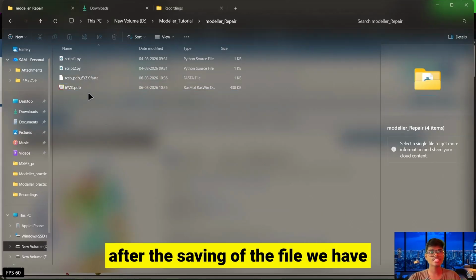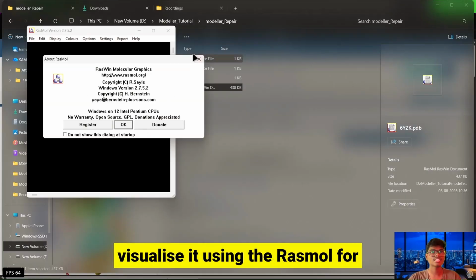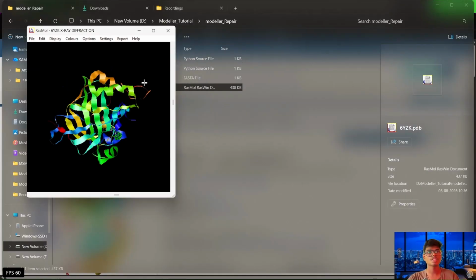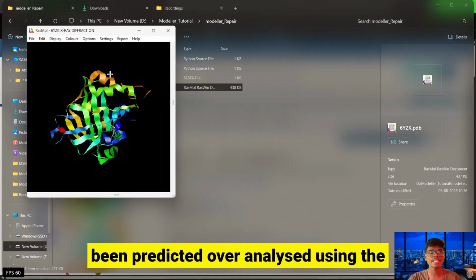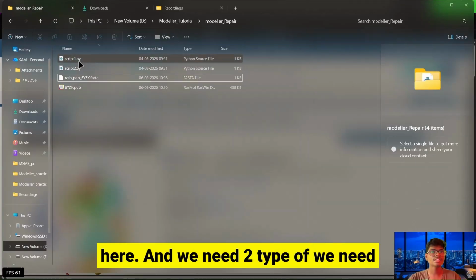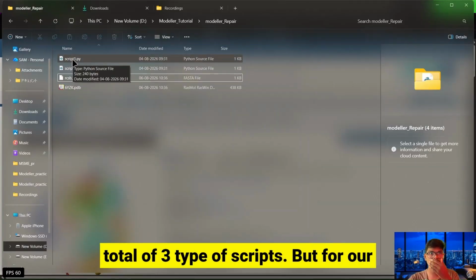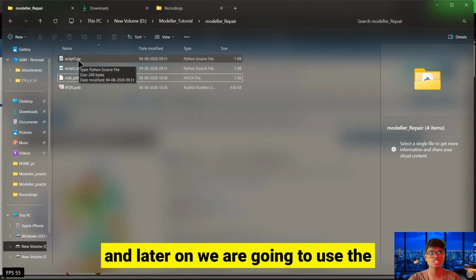After saving the file, we have the protein structure, so we can visualize it using RasMol for now. This is the protein structure, and it has been analyzed using XRD, and you will find the FASTA sequence here. We need a total of 3 scripts, but for our own convenience we have taken 2 scripts, and later on we are going to use the scripts.